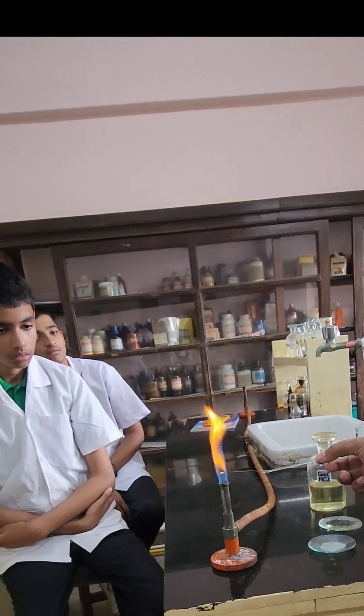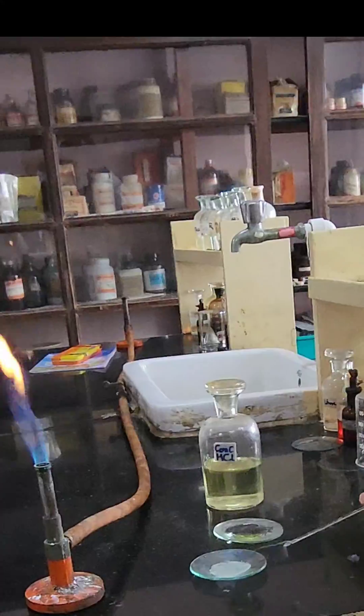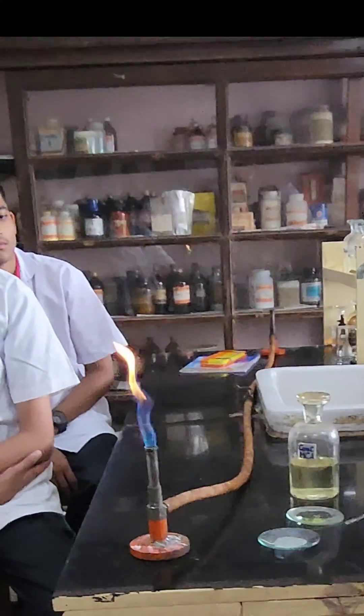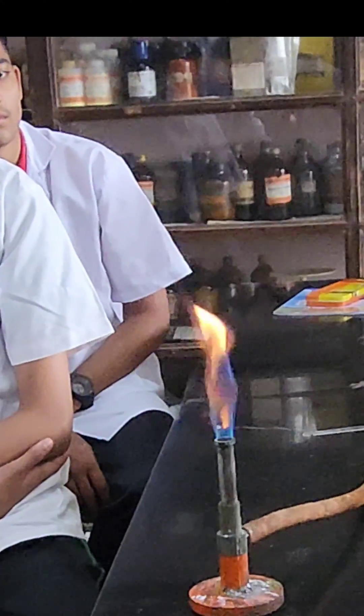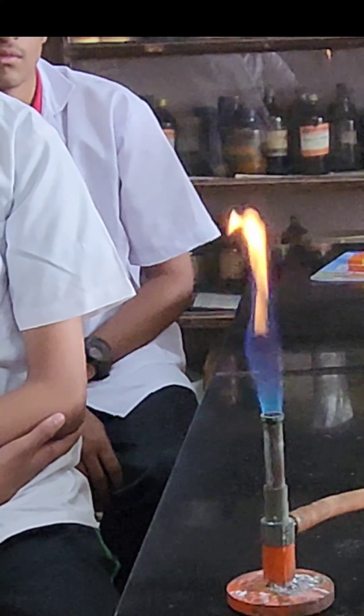You can see a color in the flame. Now we will repeat this experiment — you will be able to see only a tinge of the lilac flame, and that too only initially, in the very beginning. You will be able to see a tinge of lilac color. Lilac is a purplish color, and that too only in the beginning.